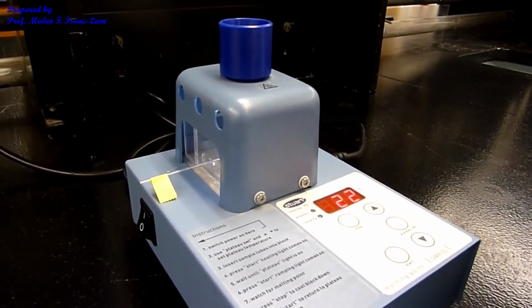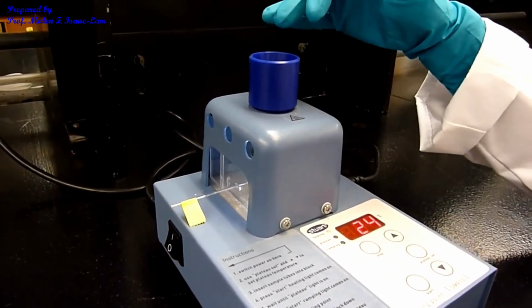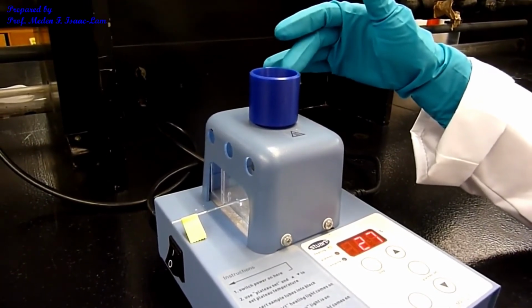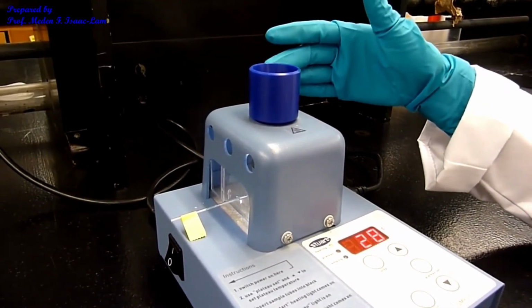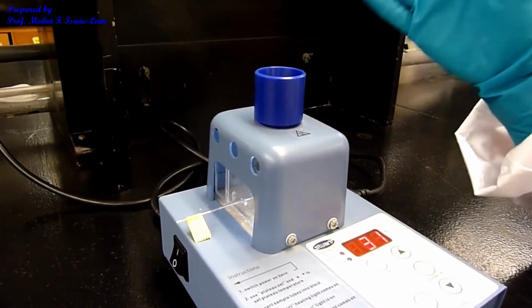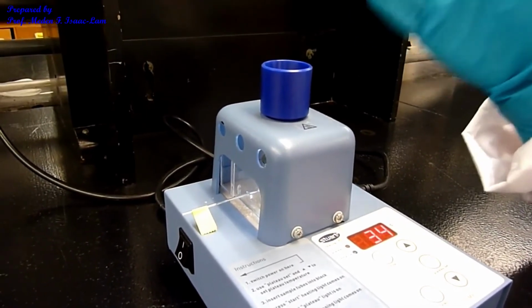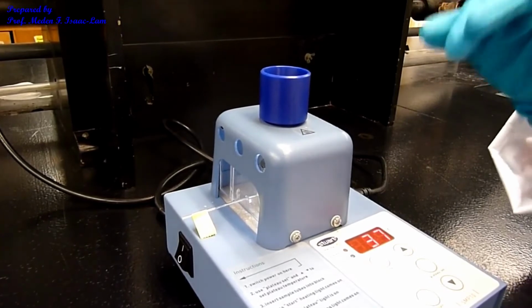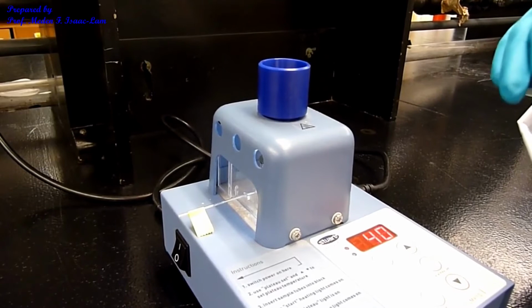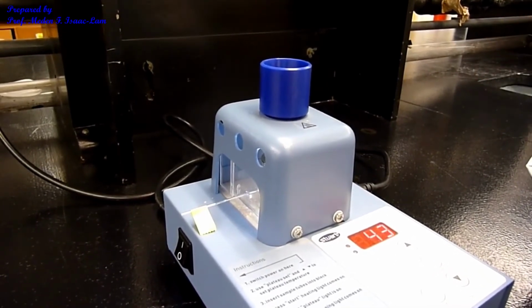So it's going to go up, and then you have to look through this eyepiece and determine if the sample will melt, meaning that it's going to change from solid state to a liquid state, and it should be sharp. So sharp means that the sample is pure, narrow melting point range, and close to that value in the table. You are trying to determine the melting point of the sample, and then you are going to finally determine the structure of the original aldehyde and ketone that we mixed together at the beginning of the experiment.